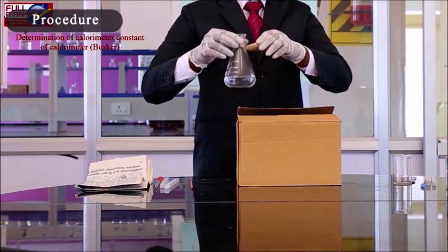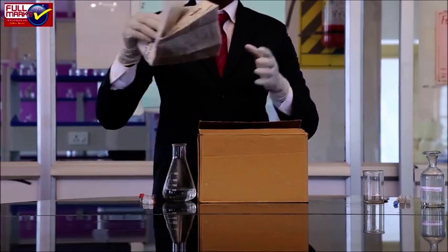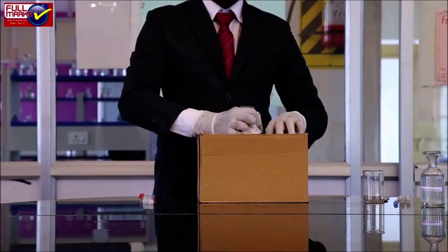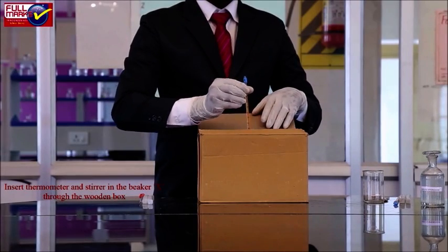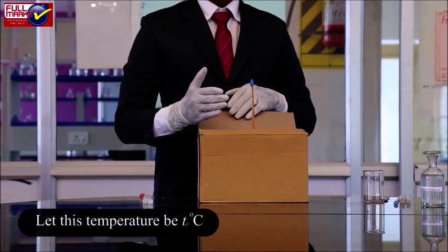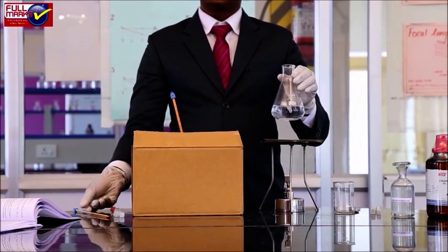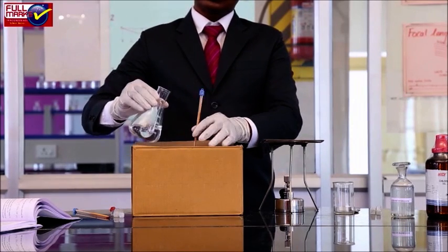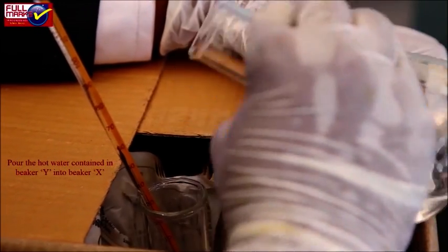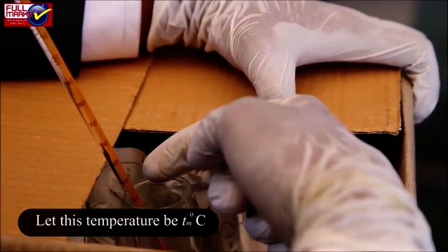Procedure: Determination of calorimeter constant of the calorimeter beaker. Take 100 ml of distilled water in a 250 ml beaker marked X. Wrap the beaker with paper around its wall and put it into a thermally insulated box like a wooden box. Insert the thermometer and stirrer in beaker X through the wooden box. Record the temperature of the water; let this temperature be Tc degrees Celsius. Take 100 ml of hot water (about 50 to 60 degrees Celsius) in another 250 ml beaker marked Y. Note the temperature of the hot water; let this be Th degrees Celsius. Put the hot water from beaker Y into beaker X, stir the mixture of hot and cold water, and note the temperature. Let this temperature be Tm degrees Celsius.